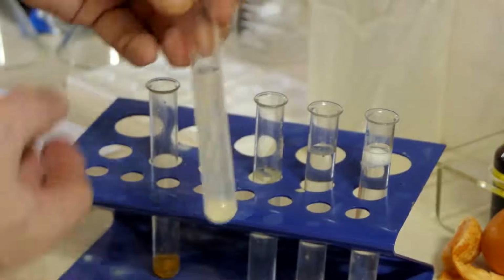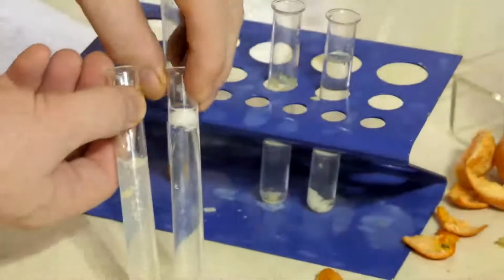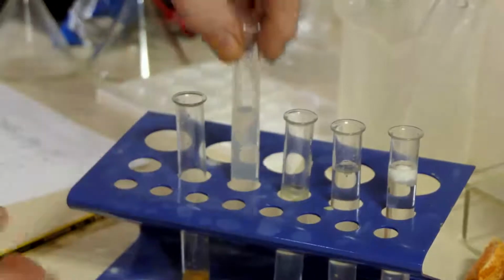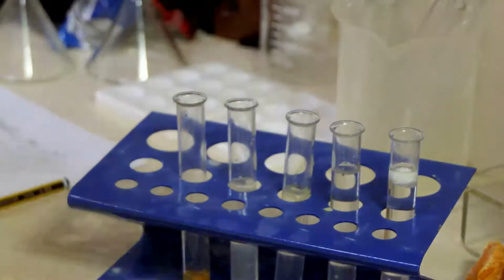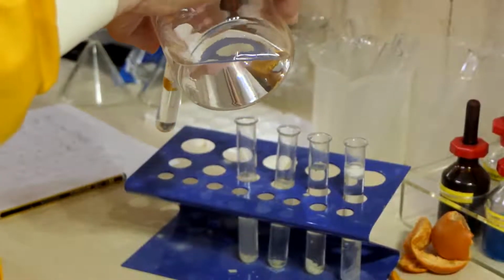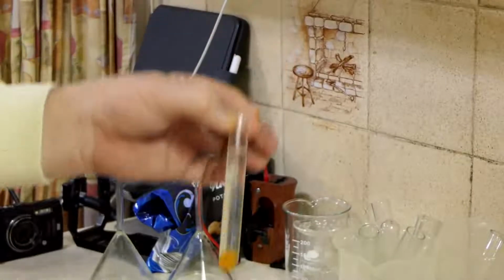So that's convincing, whereas the egg is very different. I don't know if you see that very well. So the cheese test is positive for lipid, and Satsuma finally. No, nothing there.